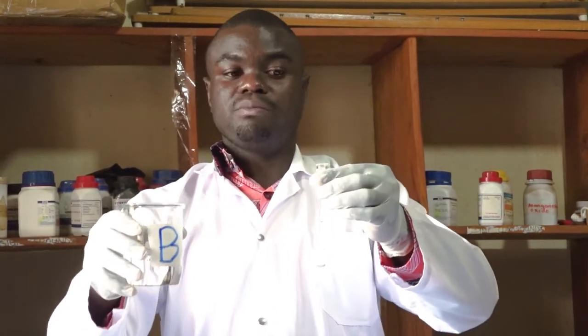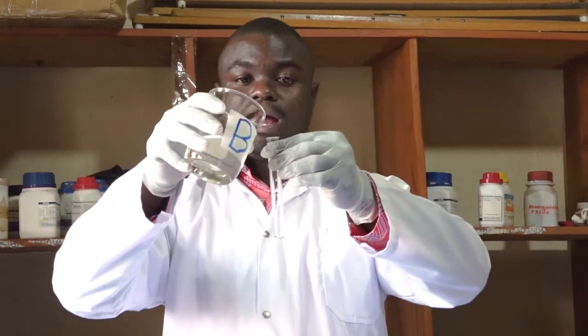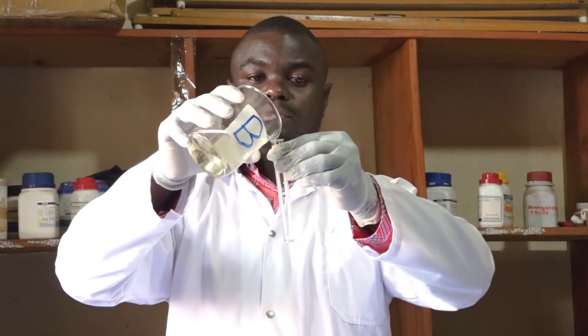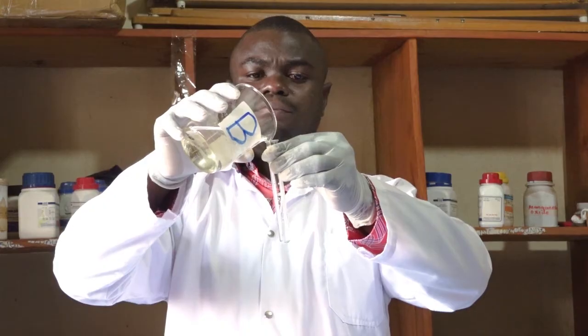We are going to repeat the same but using solution B. So again, I get my solution B, hold the test tube by the neck, and I pour one cubic centimeter.